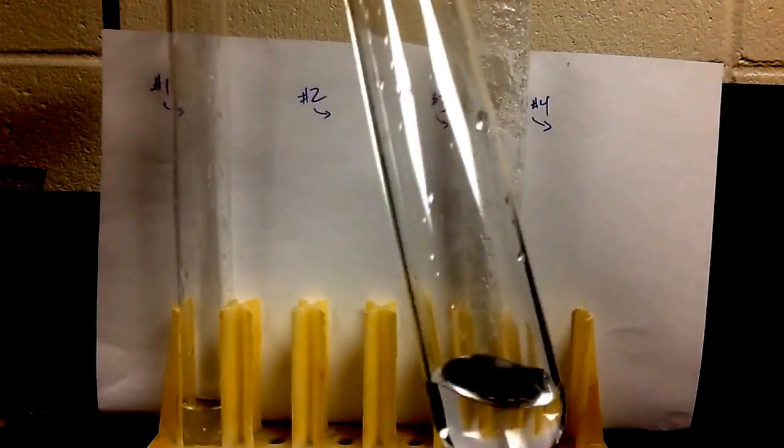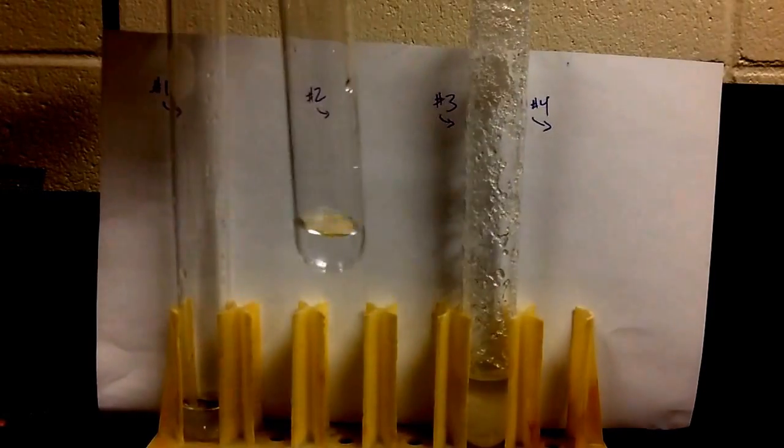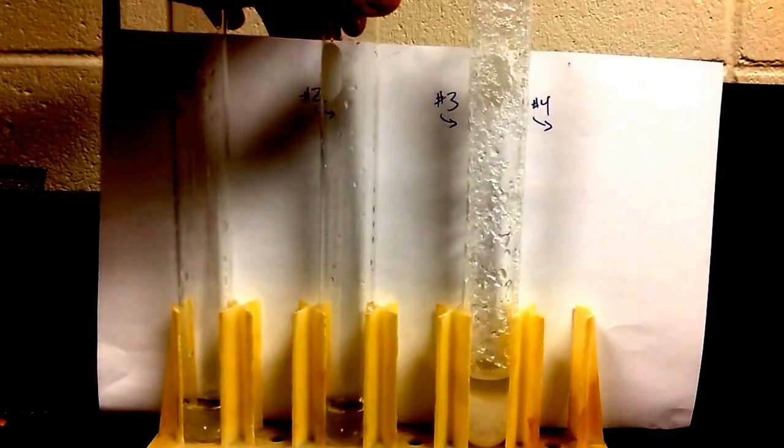Again, all of our chemical dissolved, we don't see anything in there. So what information does that tell us?